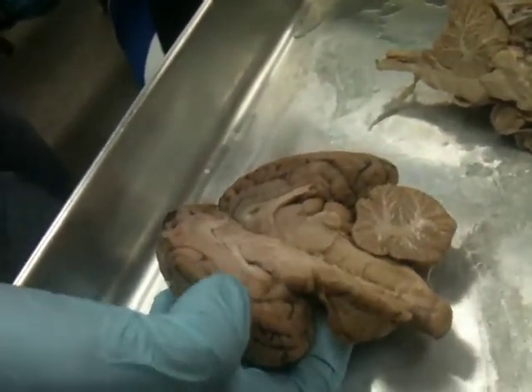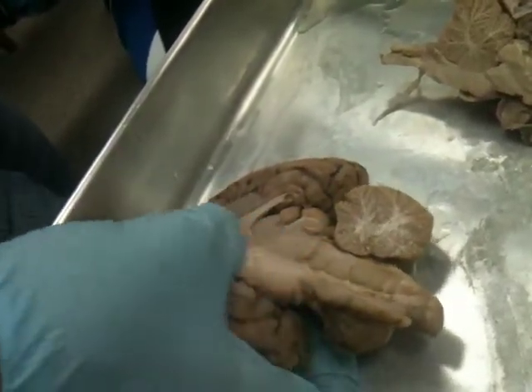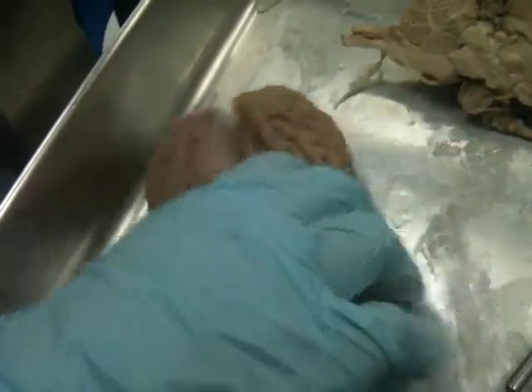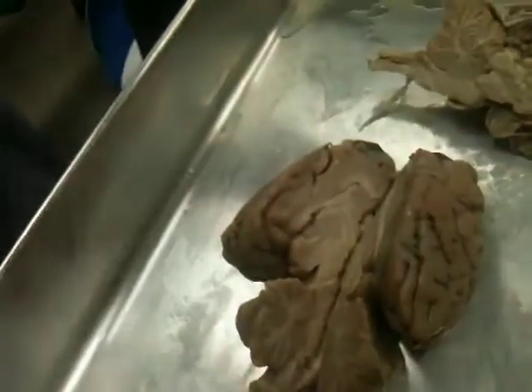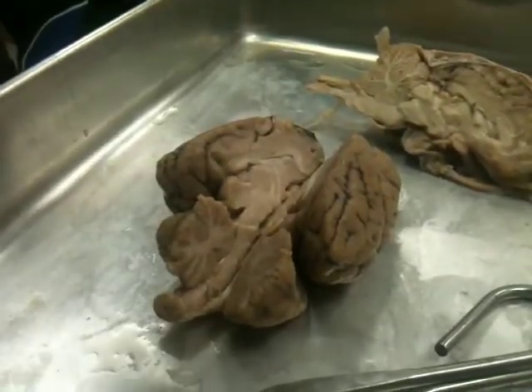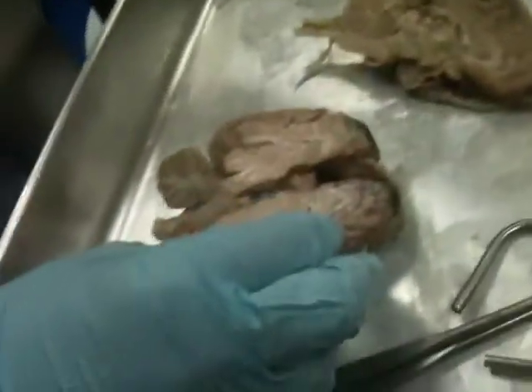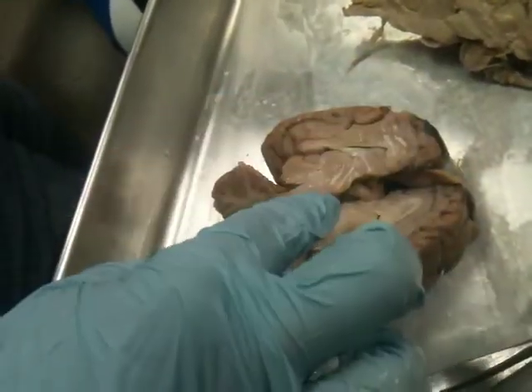The cortex is the outside layer, and then underneath that you sort of have the beginning of the diencephalon, which is divided by the corpus callosum. So you're saying that the cortex comes up like that, or what? No, none of this stuff is part of the cerebrum, right? Just this outside layer with the sulci in it is the cerebral cortex. Cerebral cortex just means outside layer. Cerebral refers to the fact that we're only talking about the cerebrum. You have the smooth layer, right? That's the corpus callosum, and all that underneath in here is going to be the diencephalon.